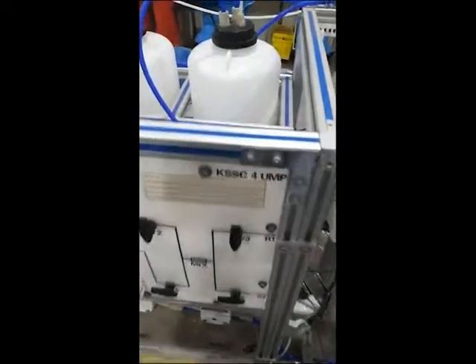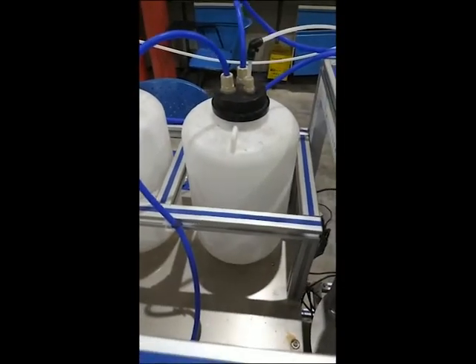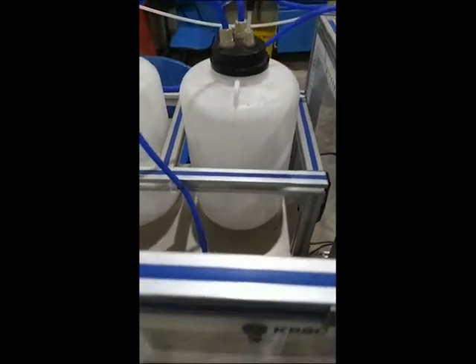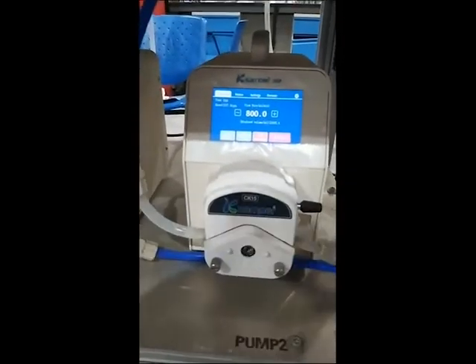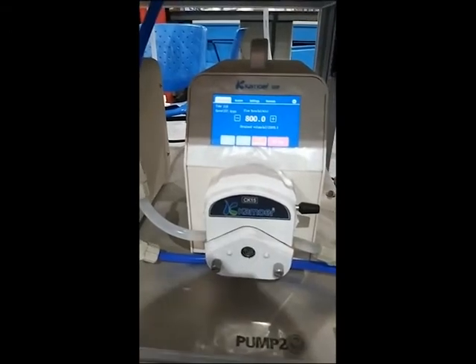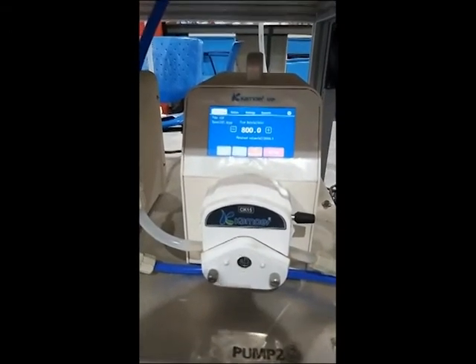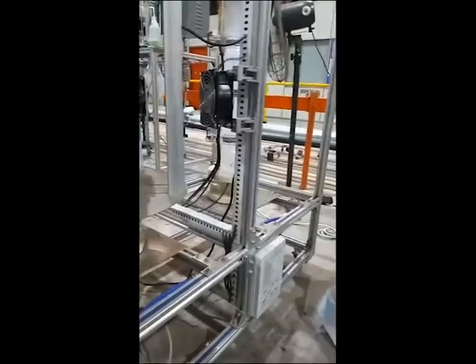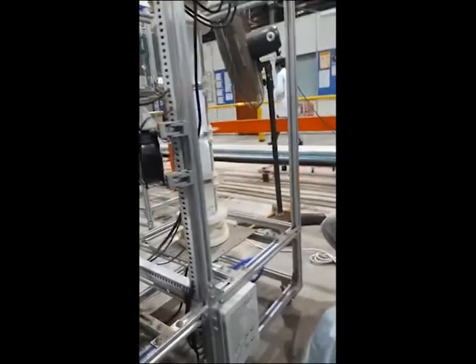When the liquid is filling inside the storage tank, you can use the water pump to let it flow into the reactor for some while to form a soaking.